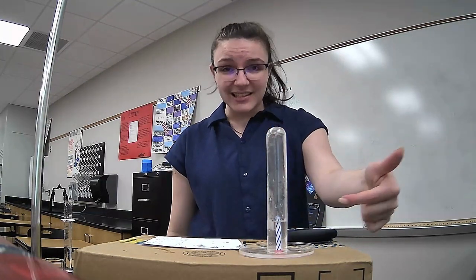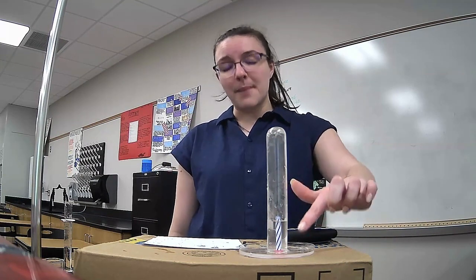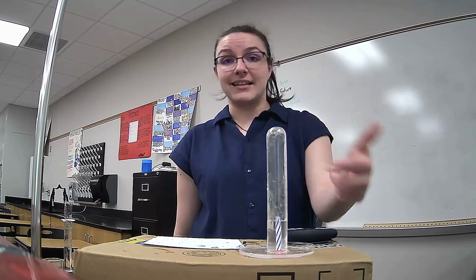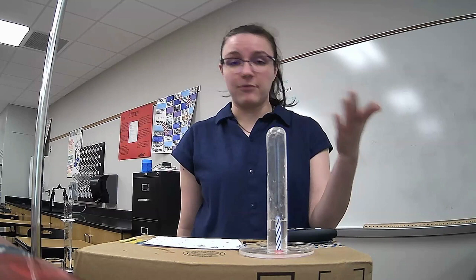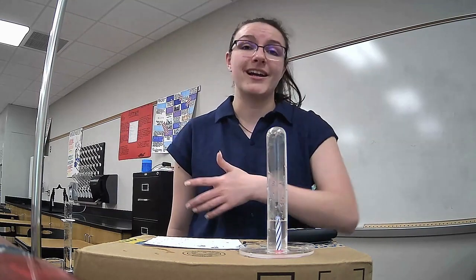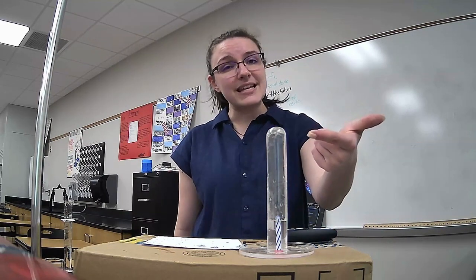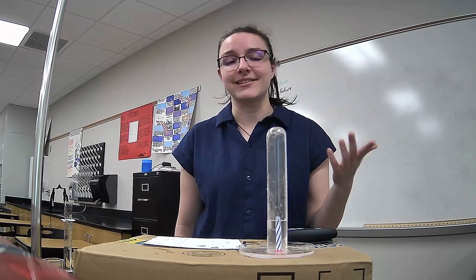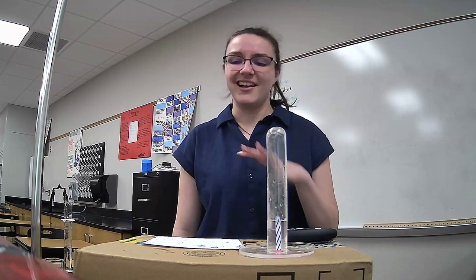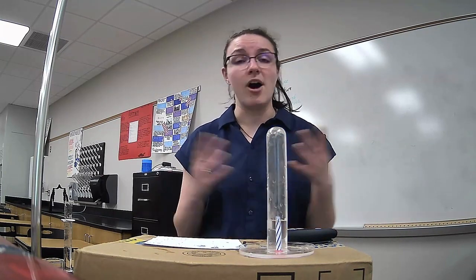The water can't be in the space where the candle is, and so the water appears to be higher or appears to have more volume because the candle is in the way. If we were able to do this without having the candle right in the middle, then we would get right about 21%. But the candle is making the water appear to go higher than it actually is going, or appear to take up more space than it is actually taking up. And so that gives us that kind of 4 or 5% error.